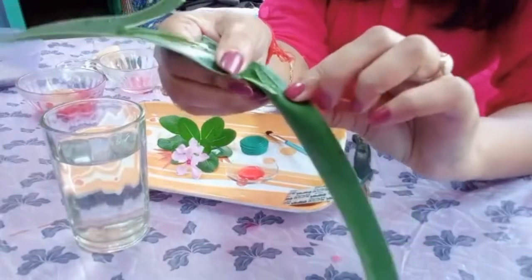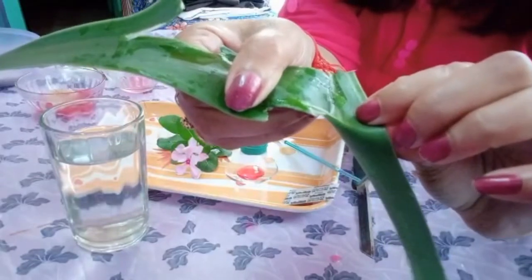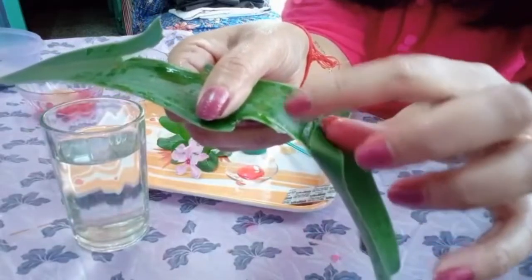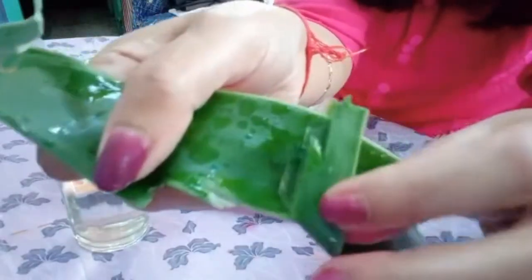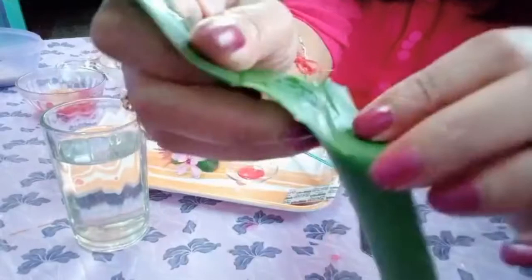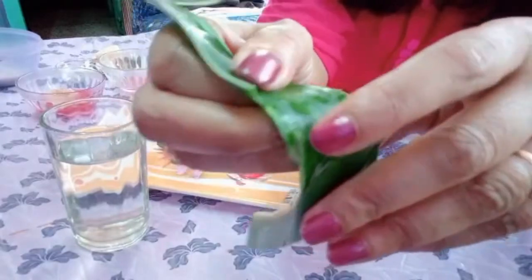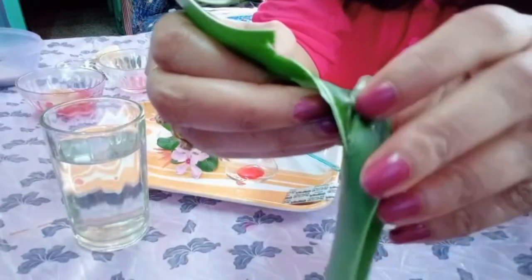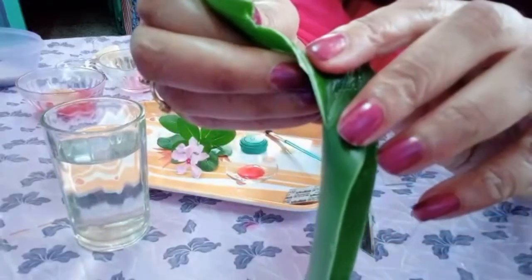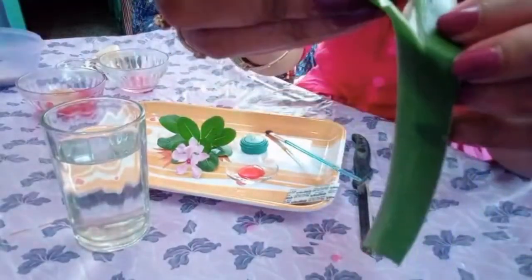Now try to locate the region. I am slitting it, and you can see this portion. Try to see it. It has to be transparent enough. This portion. See, this very slight and transparent portion is showing me the epidermal layer. Now if you ask me which layer it is showing, it is the lower epidermis. And if you take out a bit more, yes, I have got one over here.